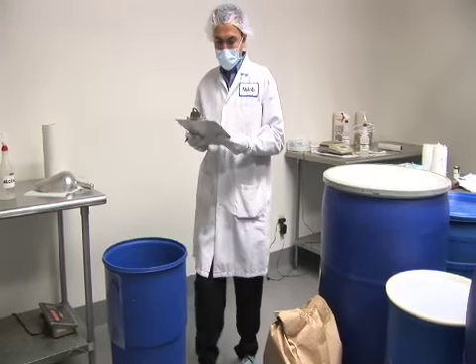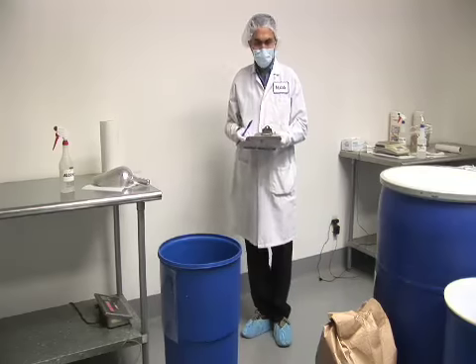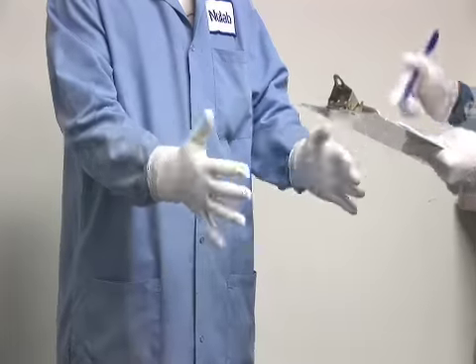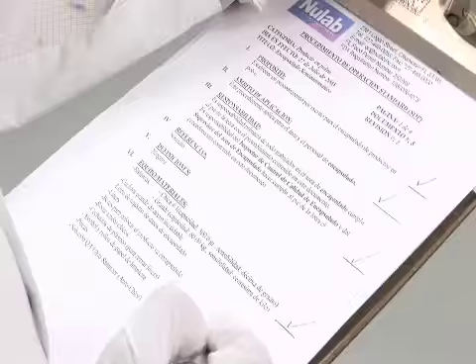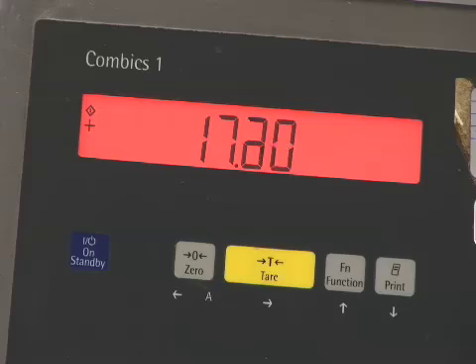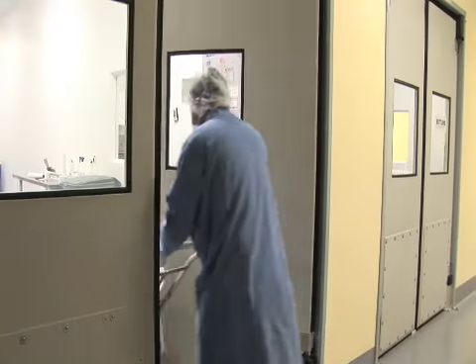The inspector then looks at the physical aspects of the weighing space. Is it clean? Has the equipment been sterilized? Are operators wearing their protective covers? The inspector goes through a checklist that leaves nothing to chance. Because weighing is so critical to the quality of the final product, the QC inspector verifies the weight of each ingredient. The powders then travel to the mixing station.